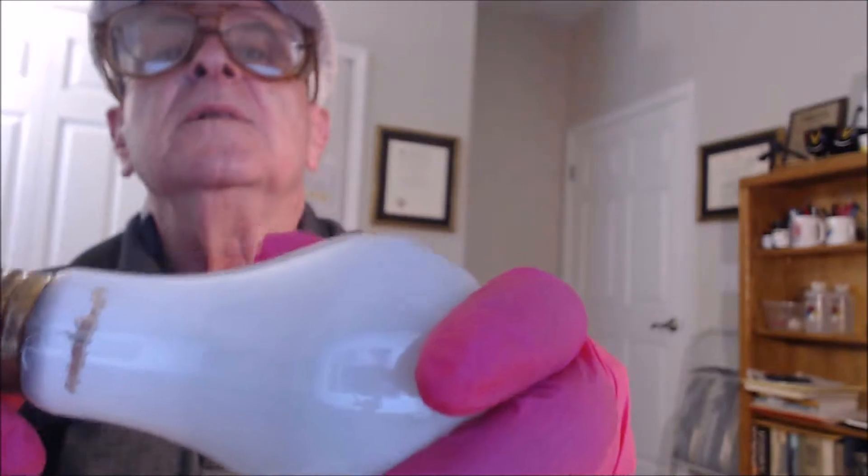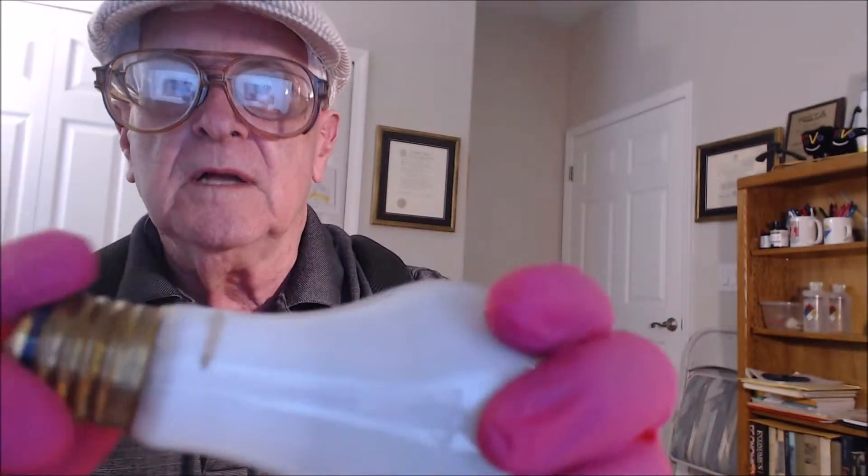I've made a little slit in here. I've got my gloves on and my glasses. I'm going to see if I can break this. Good — I was successful. I did break the filament and we'll see how it works.